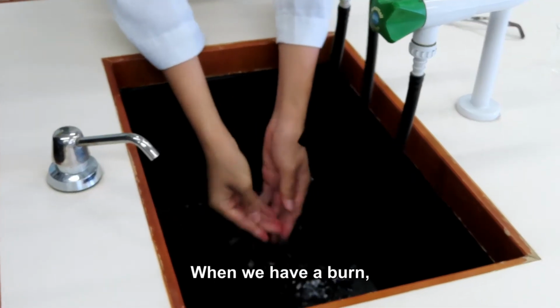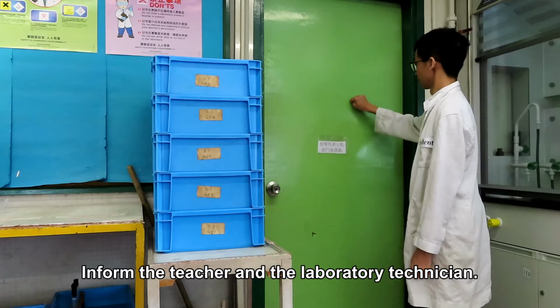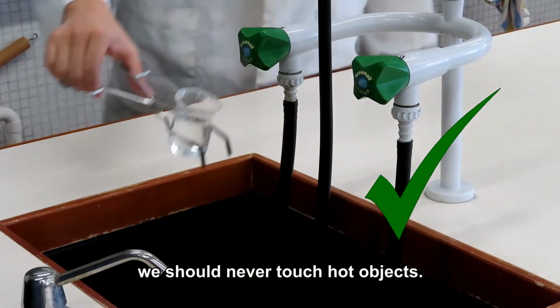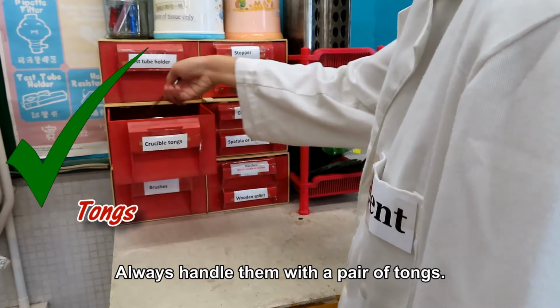When we have a burn, wash the affected area under running water immediately. Inform the teacher and the laboratory technician. To prevent having a burn, we should never touch hot objects. Always handle them with a pair of tongs.